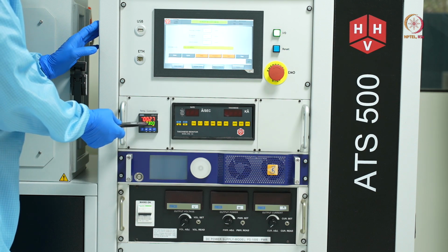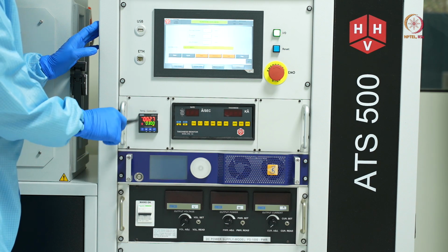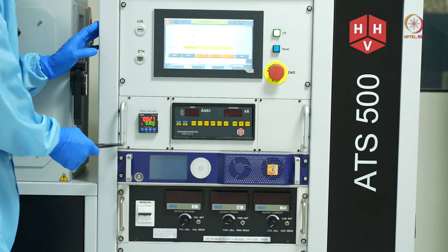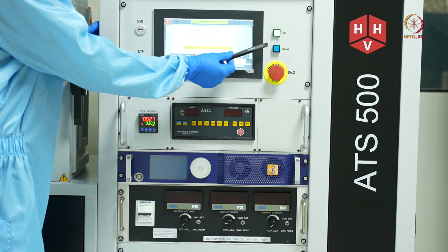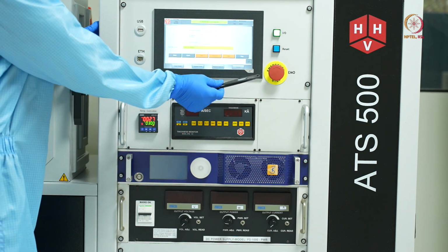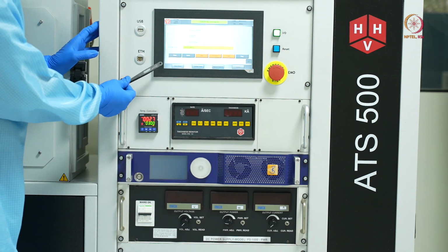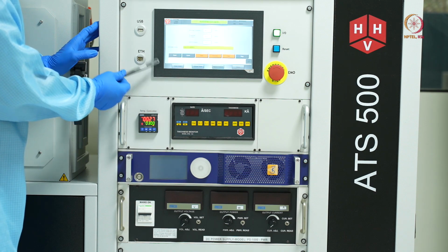It is right now set to 300, but since the heater is not on, as we are not doing the process, the heater is right now off, and the chamber is right now at 27 degrees Celsius. Next we can see the power and reset button and the emergency off button. The main control that we have is through this HMI, or the display panel.